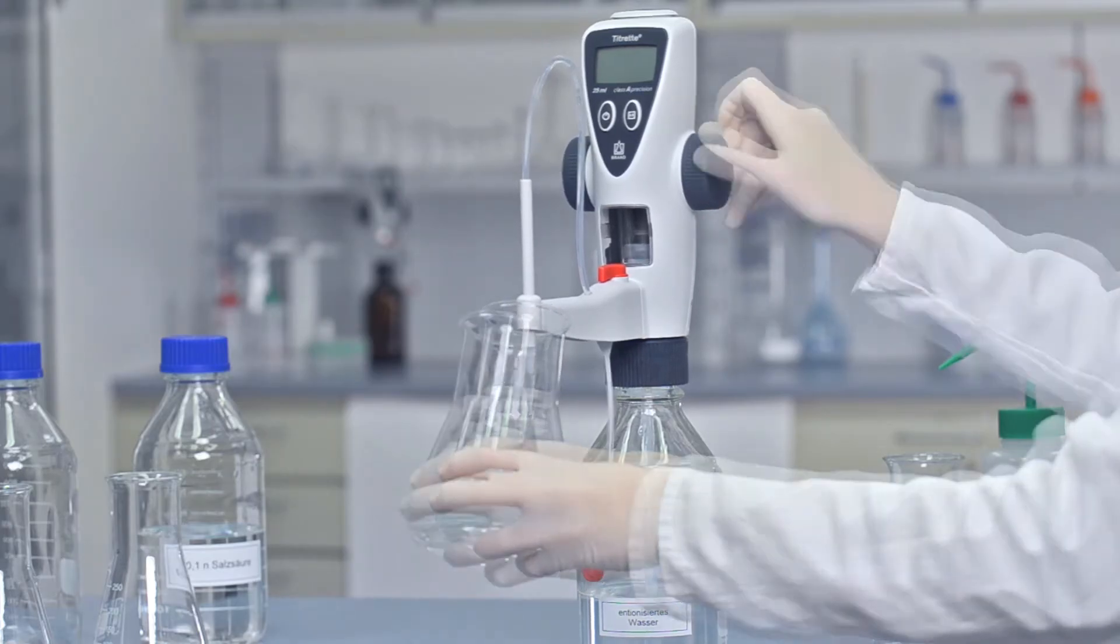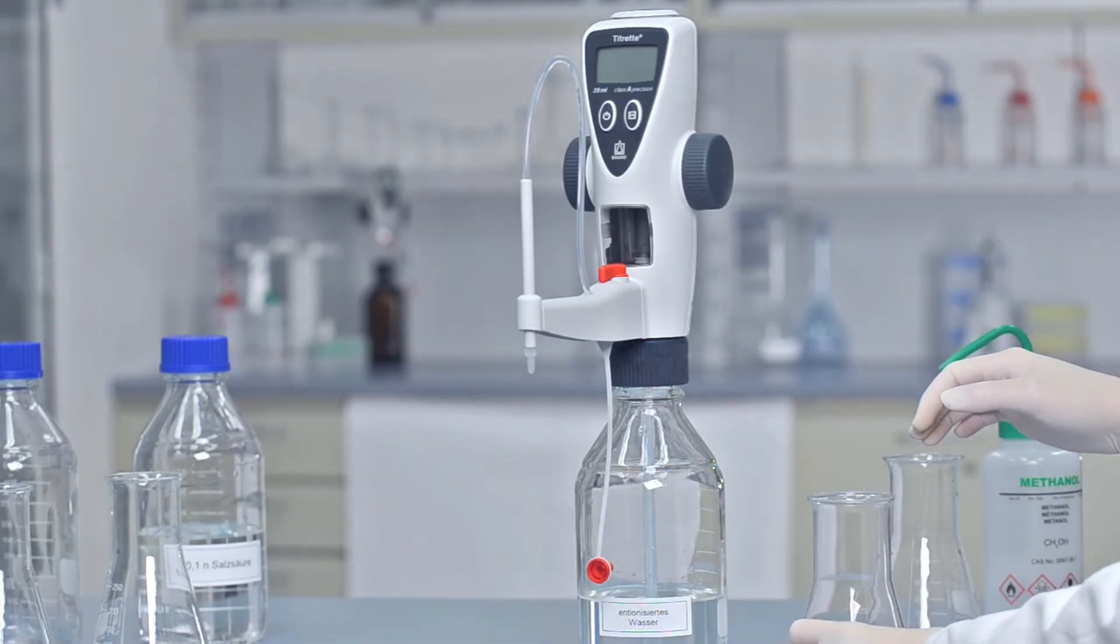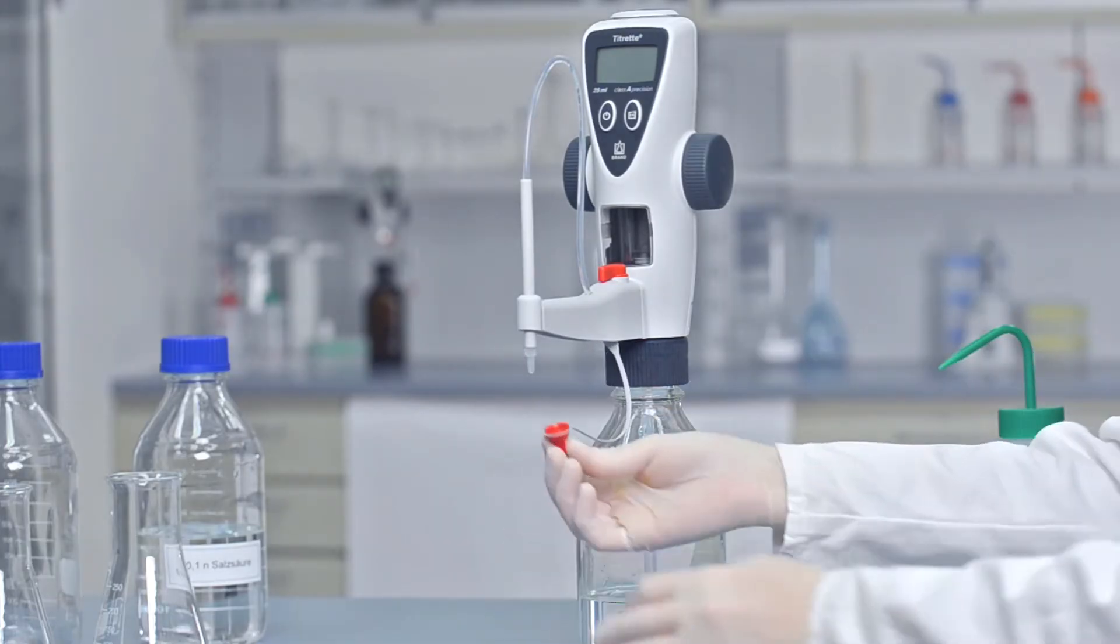Any carbonate crystals should be swabbed out with dilute acetic acid. Crystals from aqueous solutions can be swabbed out with water.